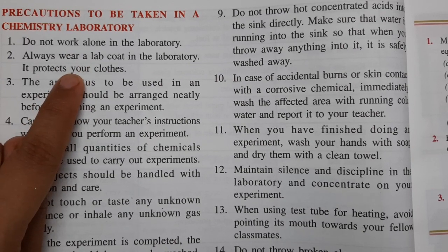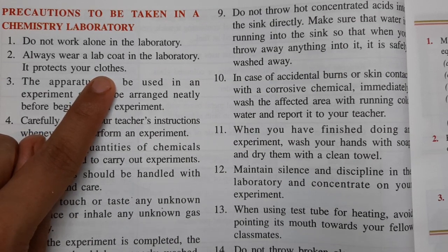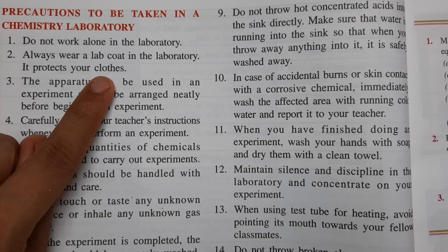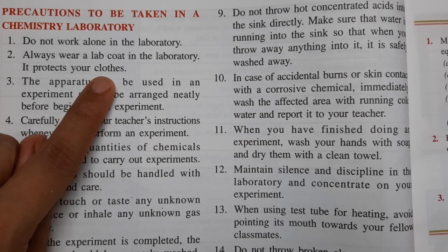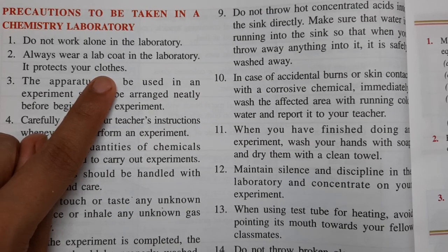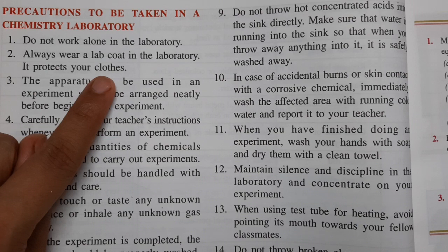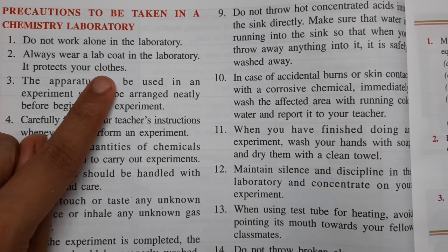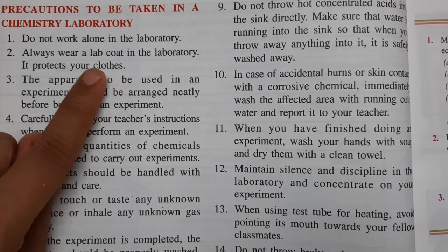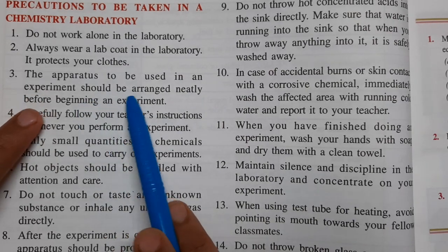A lab coat protects your clothes. When we are doing some chemical reaction, sometimes the reaction causes chemicals to come out of the vessel because of heating. This can make your clothes dirty or spoil them, and it may also come onto your skin and create marks or stains. So for protection from chemicals, you need to wear a lab coat in the laboratory.